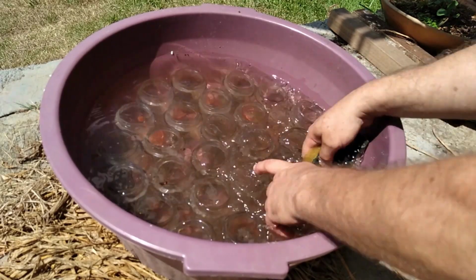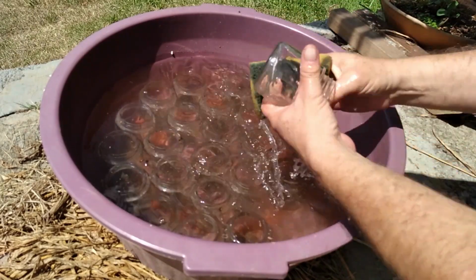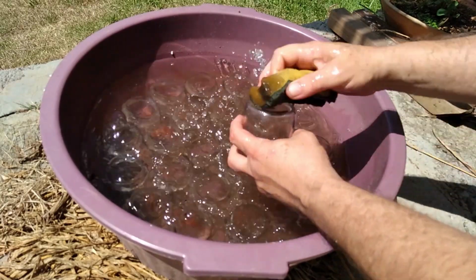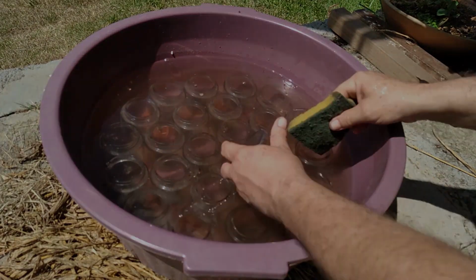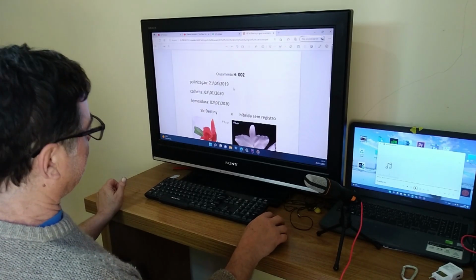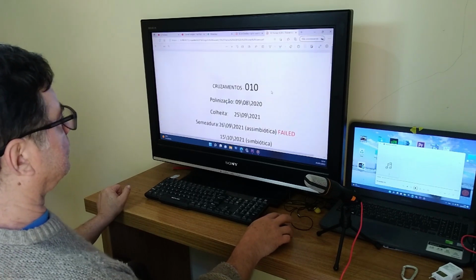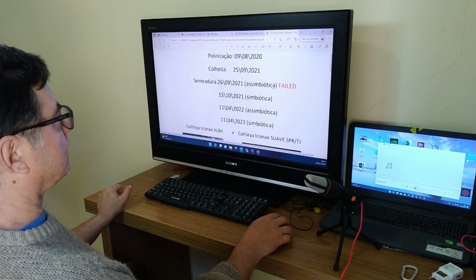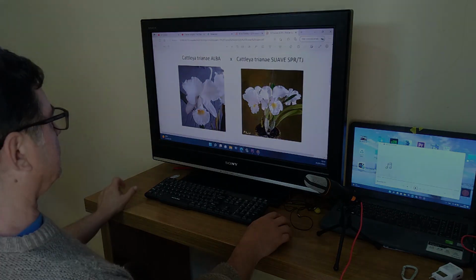But first, let me finish washing these jars from earlier explants and failed attempts. We have to sterilize and clean to reuse, or the price tag will be hard to deal with. I confess I'm not the tidiest and most organized among orchid collectors, but when it comes to seeds and jars, it is imperative to keep good track, to tag and register all that you do. Let's see what we can learn from my notes and results.